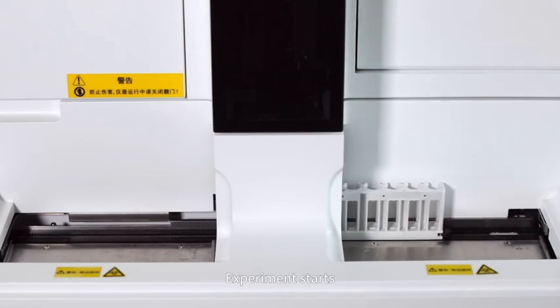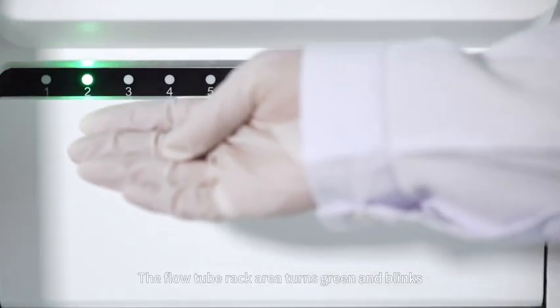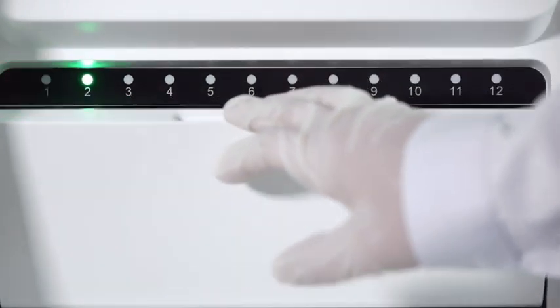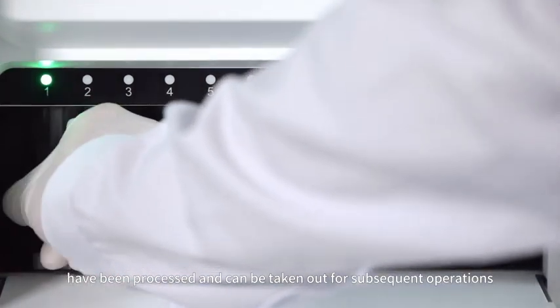7. Experiment starts. The estimated time of completion can be viewed on the task interface. It is not recommended to perform any other operations on the software during the experiment. 8. Sample preparation completed. The flow tube rack area turns green and blinks, indicating that samples in the rack have been processed and can be taken out for subsequent operations.